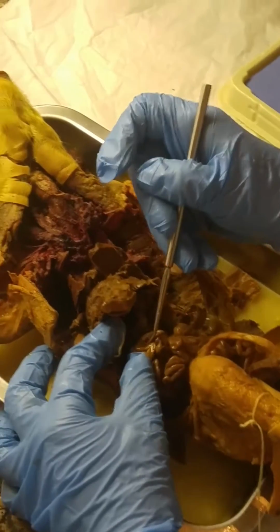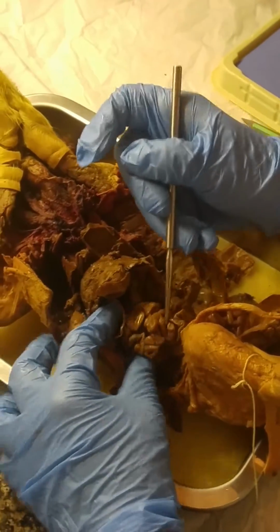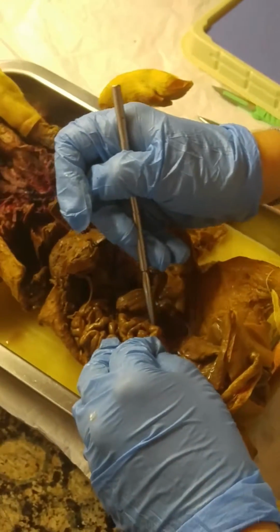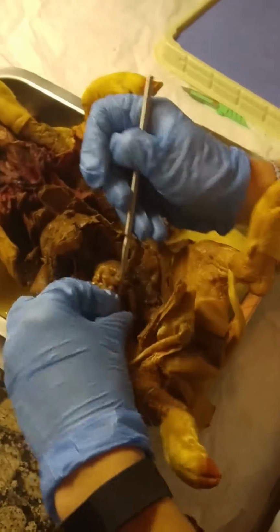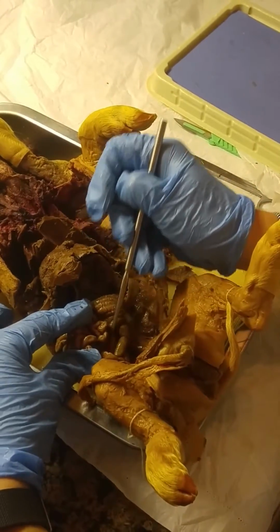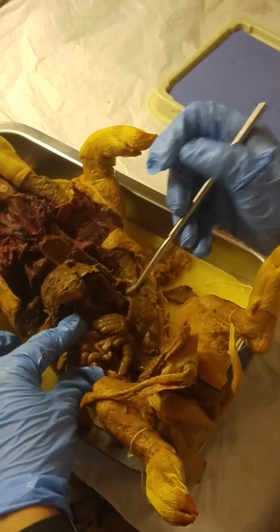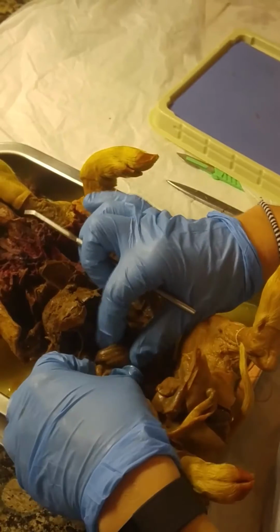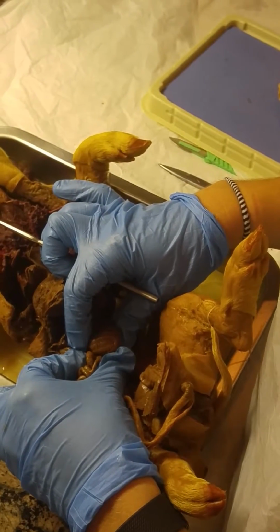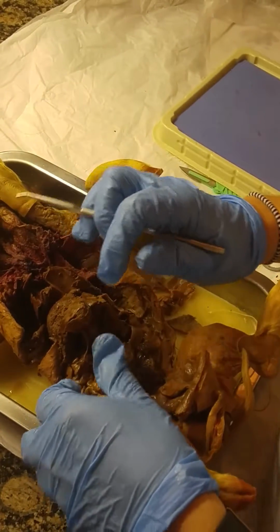Just below that, the next portion of the small intestines would be the jejunum. And then at the base is the ileum running down here. It's the third part of the small intestines, just before the large intestines, which would be this large separate structure here. So stomach, duodenum, ileum, jejunum, pancreas, spleen, large intestines. One more.